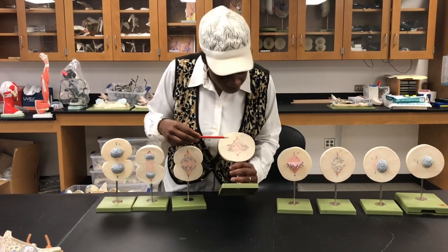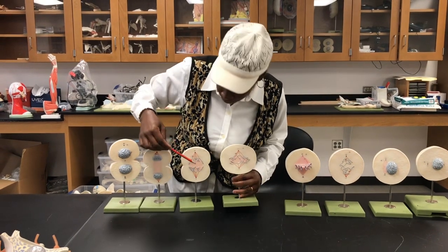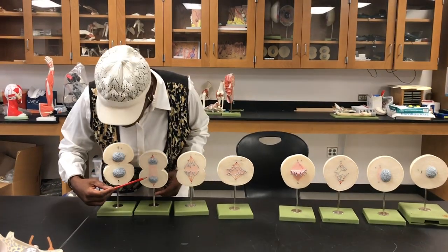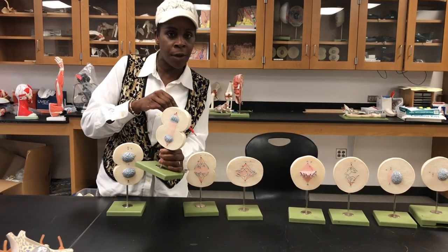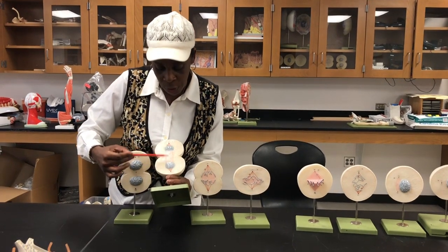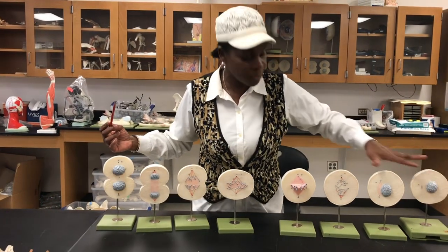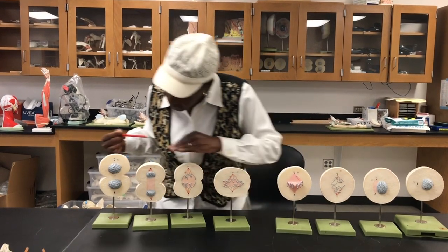Here, you can see that after the metaphase, we have the beginning of the anaphase. The anaphase will be when the spindles are holding and pulling the chromosomes to the top and bottom. Here you can see at the telophase, the cell has two different sides, just like in the late stage of anaphase. Here you can see the spindle pulling, the nuclear envelopes are forming again, and then in the cytokinesis, the two cells are dividing. Again, we've got the prophase, the prometaphase, the metaphase, early anaphase, telophase, and cytokinesis.